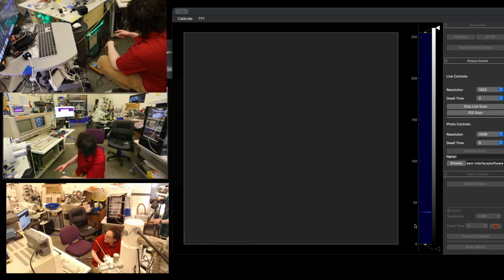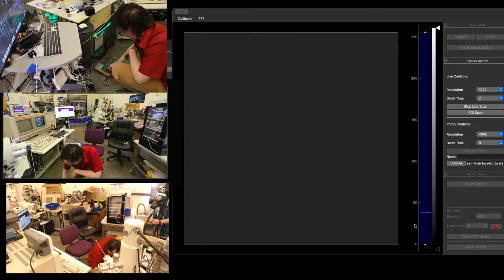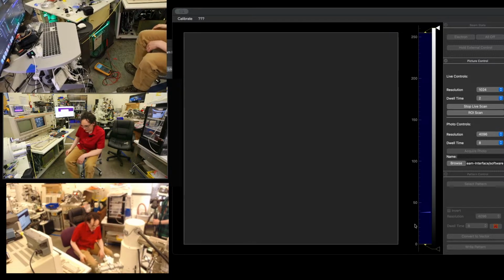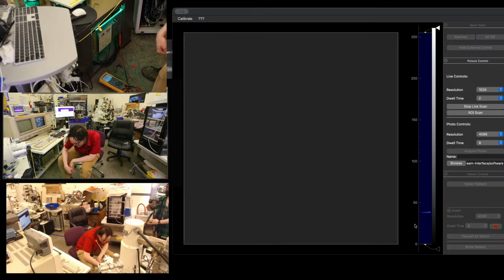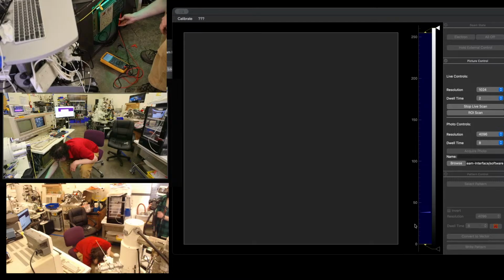It tried cycling the valve again, and it just turned that off. Yeah, it's cycling. The high voltage interlock is going in and out. Okay, we are reading differently now. We got 4.5 microamps DC. Let's switch to PG1, see if PG1 is maybe the source of our issue.